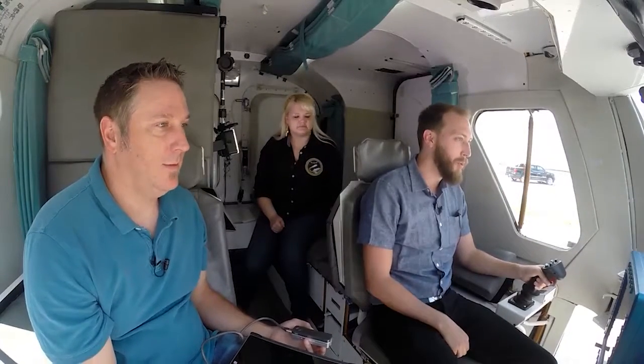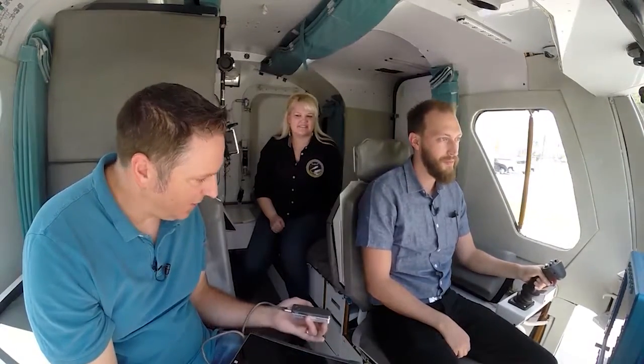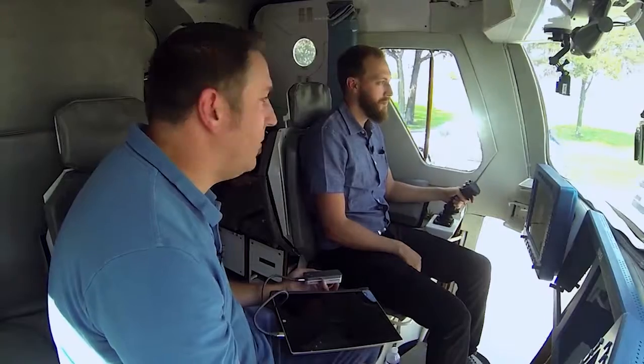So, I heard you guys are working on the biomolecule sequencer. Now, I mean, what the heck is that? It sounds like something off of a superhero's utility belt or something. Yeah, well, basically, there's a little portable sequencer that we happen to bring with us. We're basically just trying to make it so you can sequence DNA anywhere, whether that's in a rover going to the meeting, or on the planet Mars, or on the International Space Station.